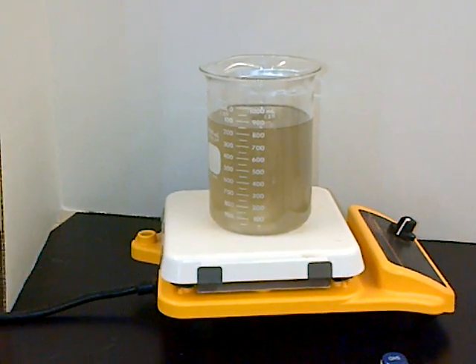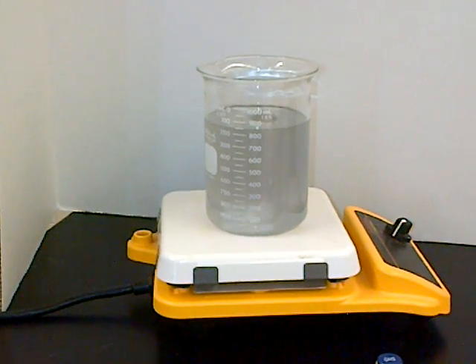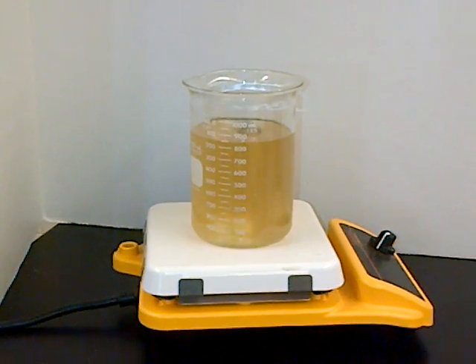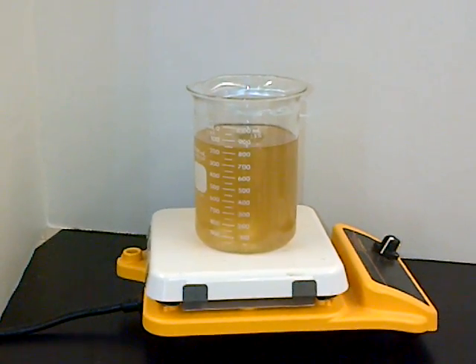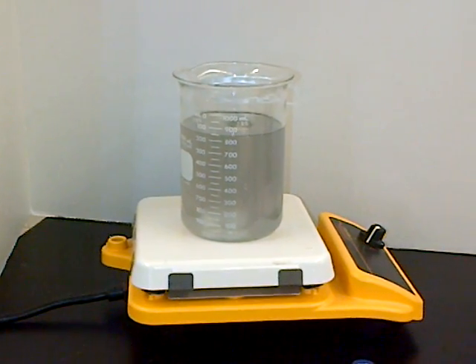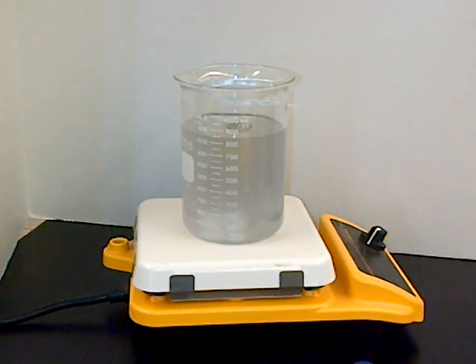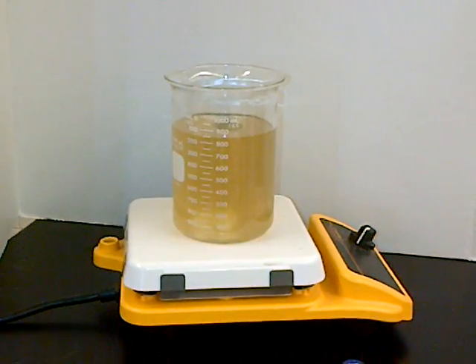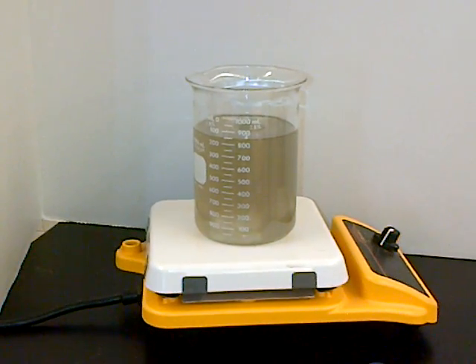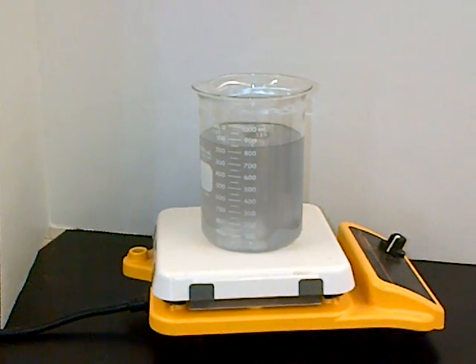So what this is, is potassium iodate. Remember iodate — we used it in the iodine clock reaction — KIO3. What happens is the KIO3 goes to I- then goes to I2. There's sulfuric acid in there, not very pretty smelling. I is not very pretty smelling. Malonic acid is an organic acid in there. Potassium is not too bad. Sulfur is really bad — there's a little bit of sulfur, but there's no sulfur dioxides or anything.